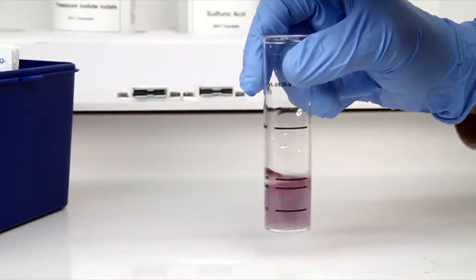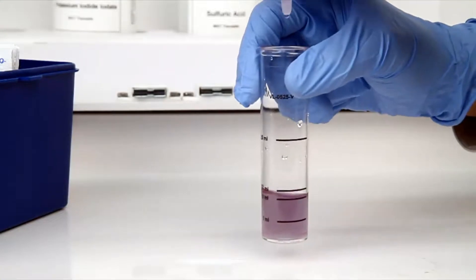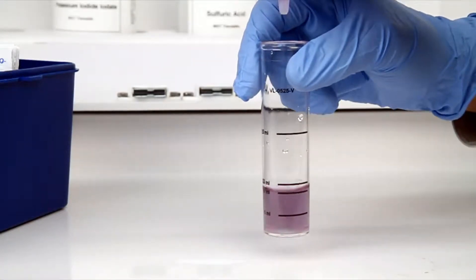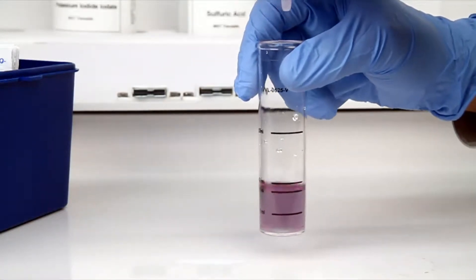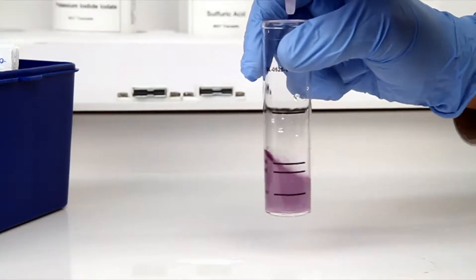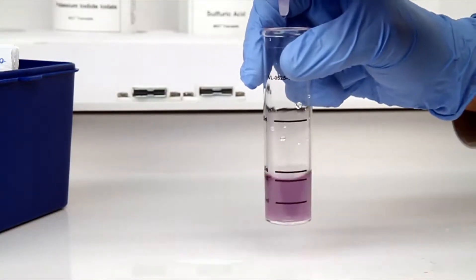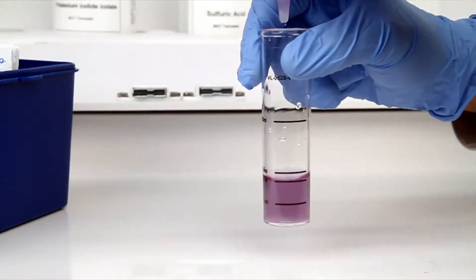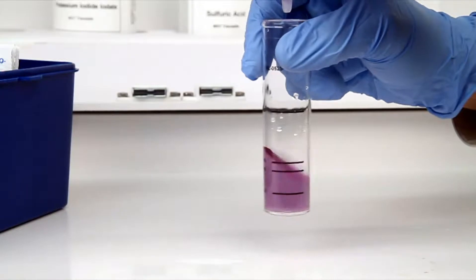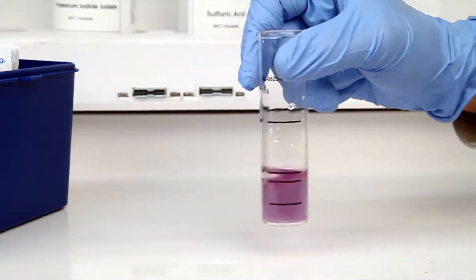After the addition of each drop of titrant, you want to swirl the vial to make sure the sample is properly mixed. You may get a gray intermediate color as you add the titrant. Continue to titrate the sample until all the green or gray color is gone and the sample turns purple.